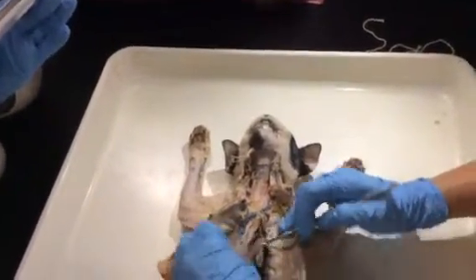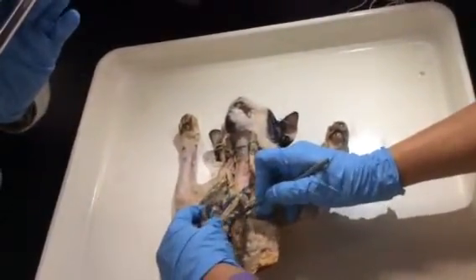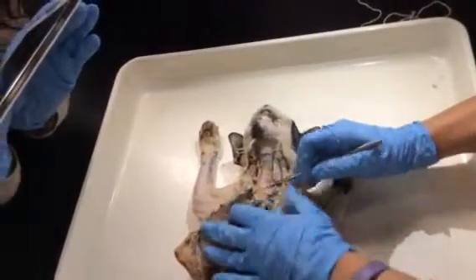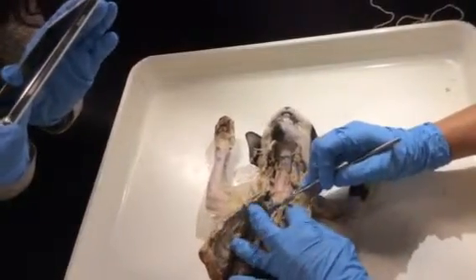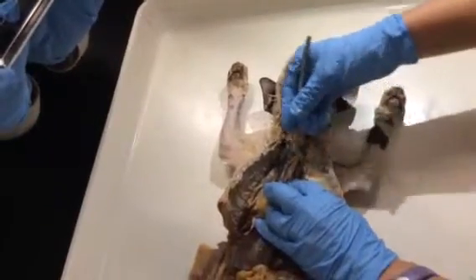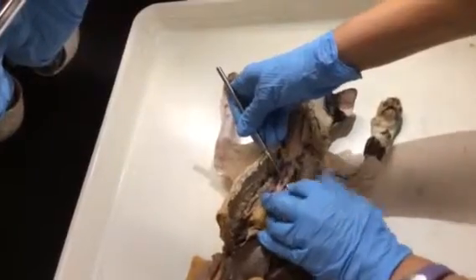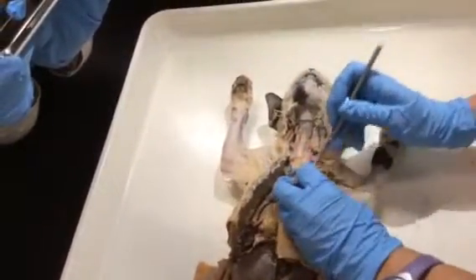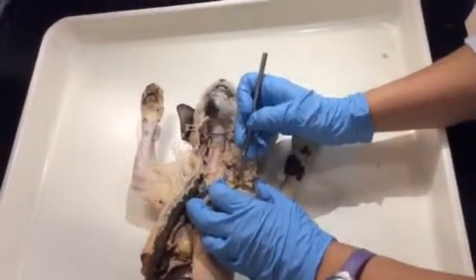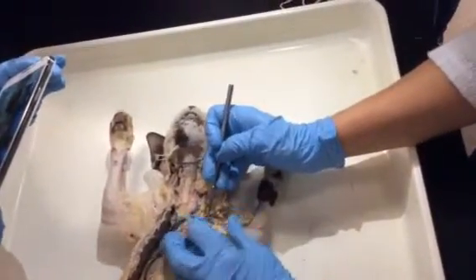The thoracic duct would be visible underneath here, and it might be in this area. Then following our brachiocephalic parallel down from the aortic arch, we also have the left subclavian artery coming out, which goes into the axillary artery and then into the brachial artery. And you can tell the difference because we can see here a lot of these whitish lymph nodes directly visible.